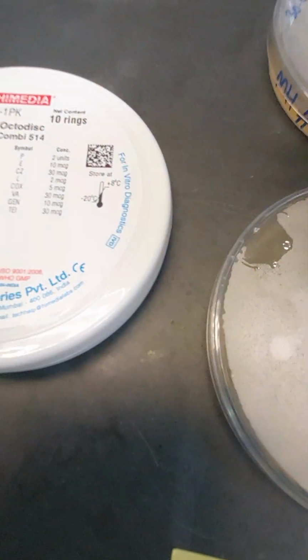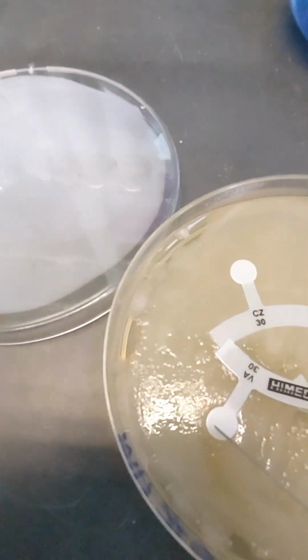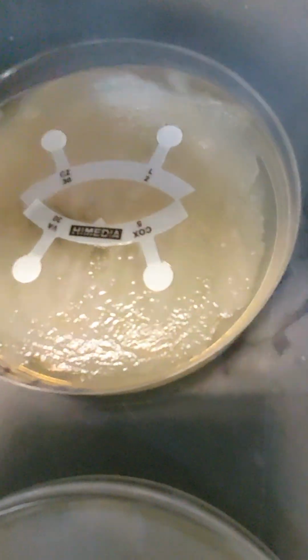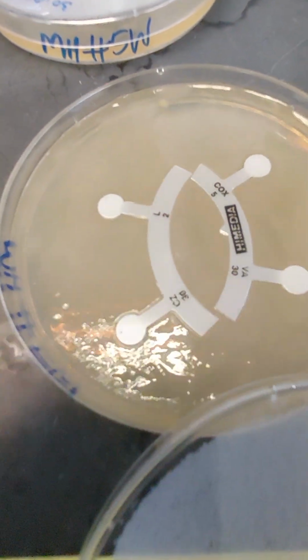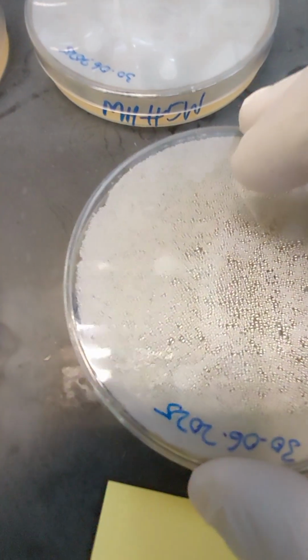Let's look at this same strain number 7FG with another set of antibiotics. If you look closely, no inhibition. The microbe appears to be growing freely in the presence of these antibiotics. So that tells us some very interesting information about this particular microbe, and we'll go into that later when we analyze the data. Now we look at number 5W. Let's look at 5W closely, and we can see, yes, it's resistant to all these antibiotics. We'll note that down in our results later.